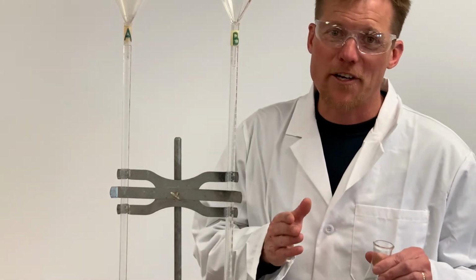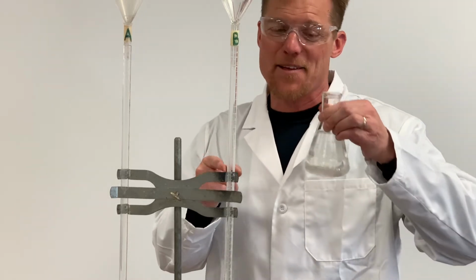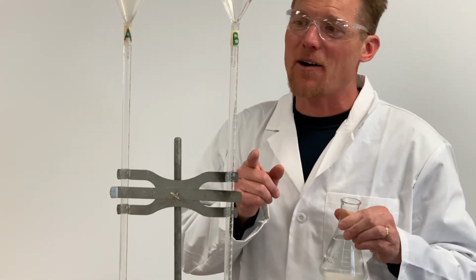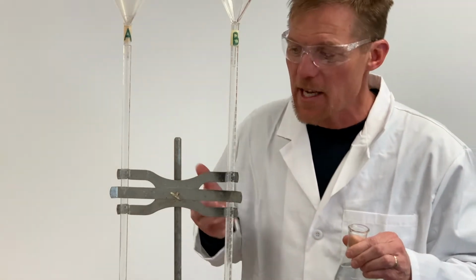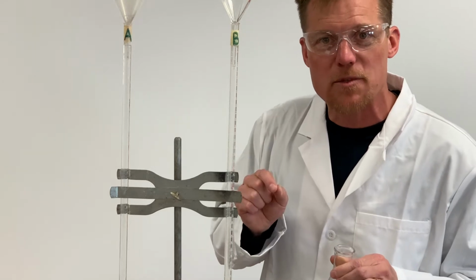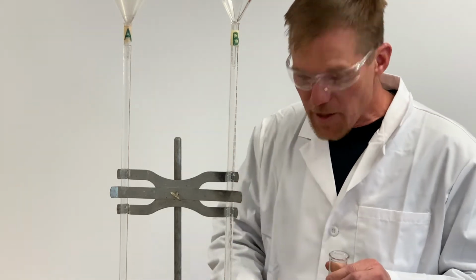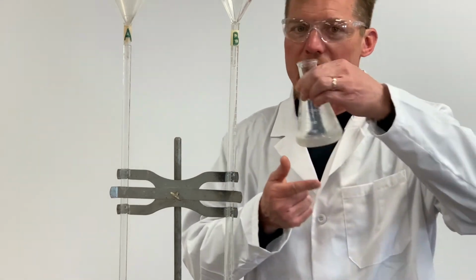All right, I know you want your calculations to be accurate. So before we add our base to the burette, we need to think about, shoot, did I clean this? And you probably did, actually. The problem, though, is that when you cleaned it, if you rinsed it out with some distilled water, there might still be distilled water in the burette. Well, what's that gonna do to our base when we add it?